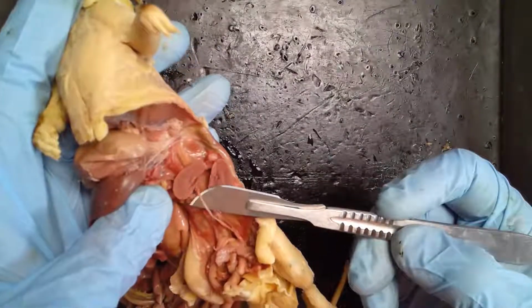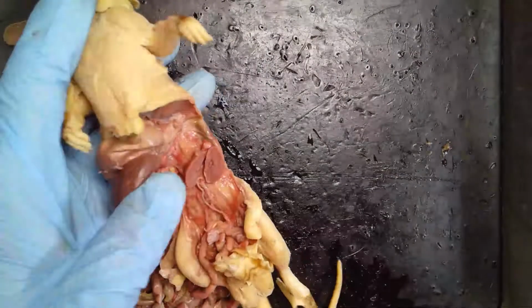Is that still on the camera? Yeah. All right. So that's the kidney. Go ahead and stop the video.